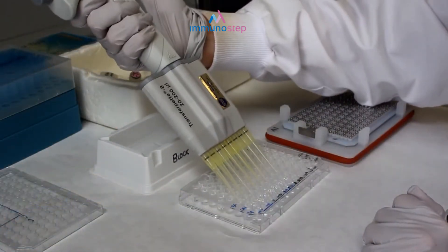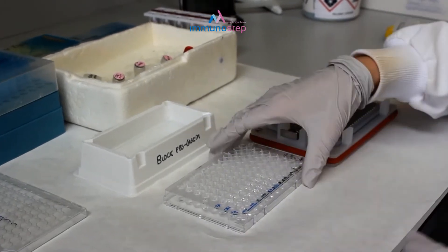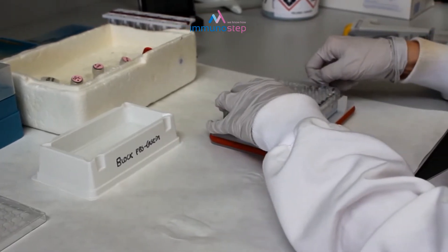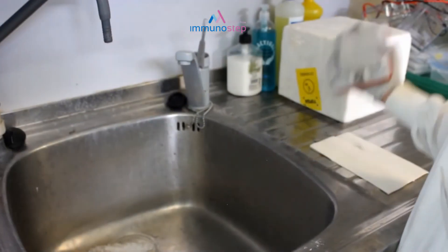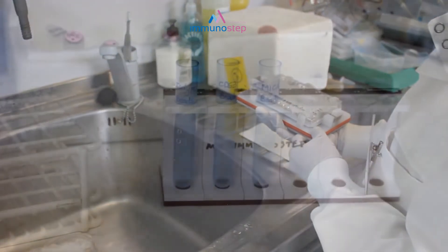In case that you prefer to perform the assay in a 96-well plate, you can also use a plate magnet to wash. If you don't have a magnet, don't worry — the beads can be pelleted to the bottom of the tube with a centrifugation.